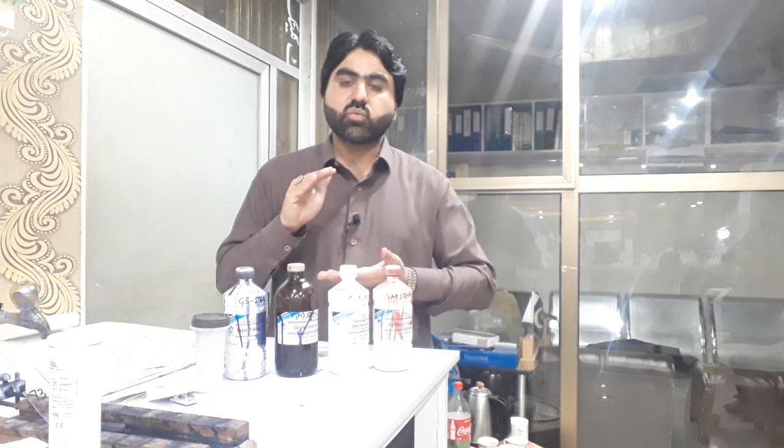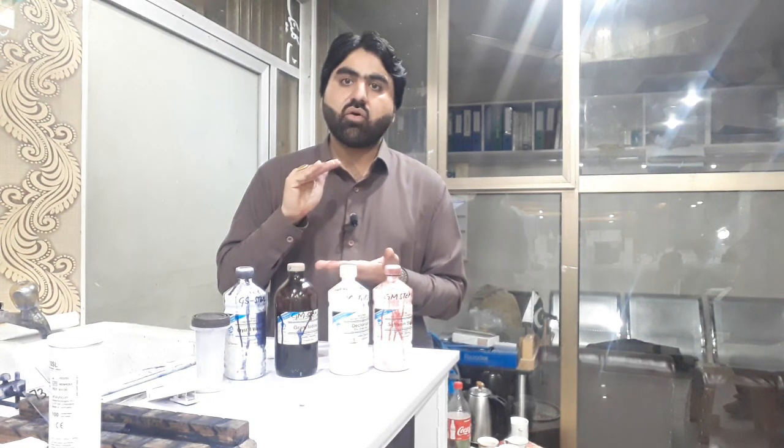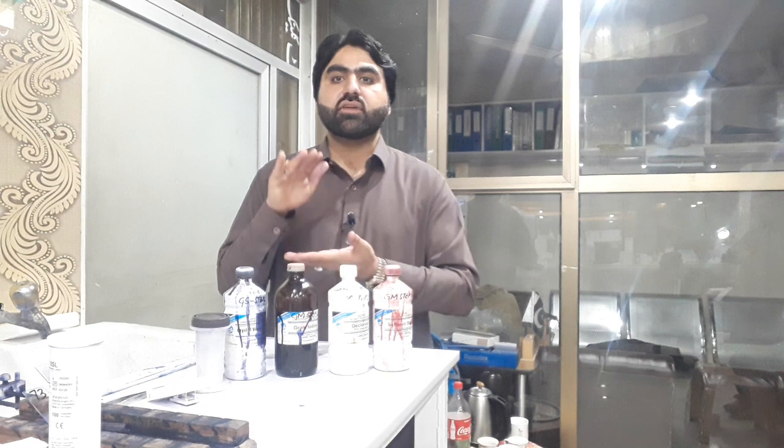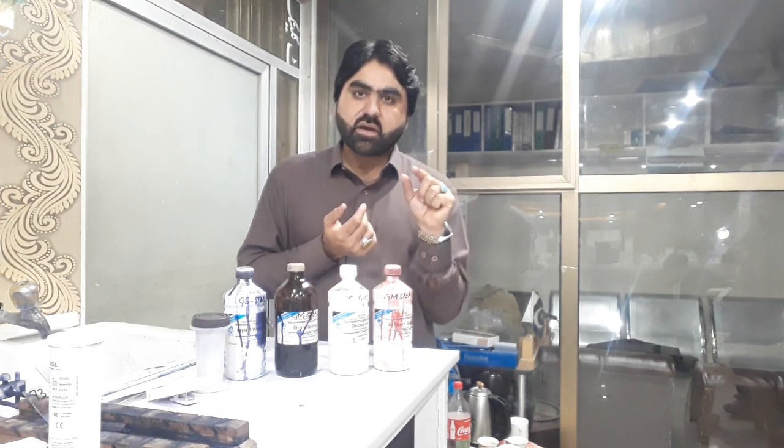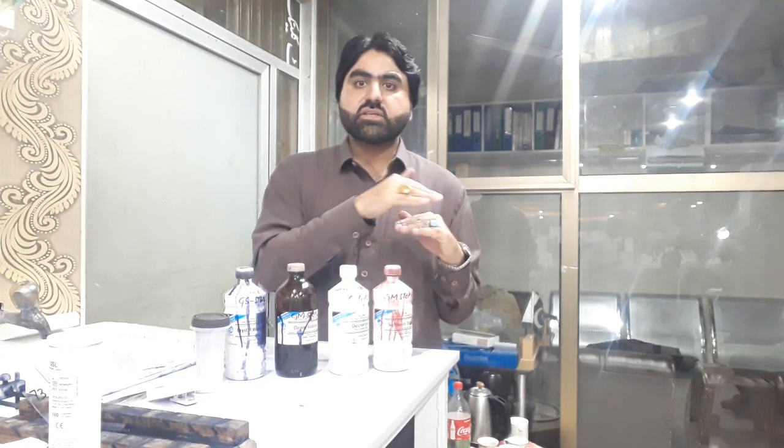In gram positive bacteria, the layer of peptidoglycan is very thick, making up almost 90 percent of the cell wall. In gram negative bacteria, the layer of peptidoglycan is very thin, constituting about 10 percent of the cell wall. In gram negative bacteria, this thin peptidoglycan layer is further covered by an outer membrane made up of protein and phospholipid.